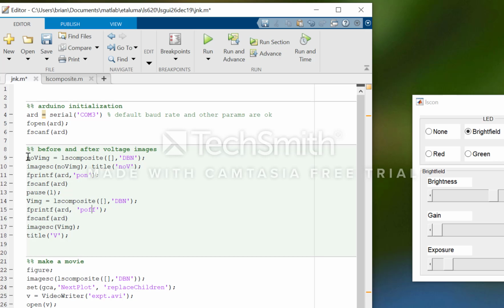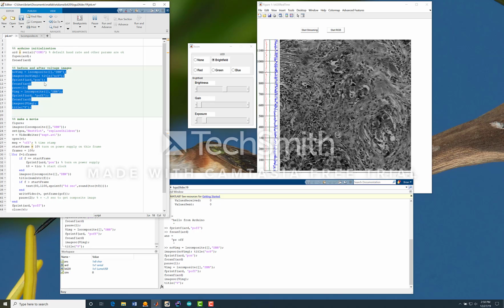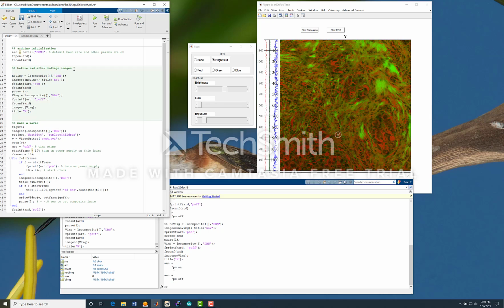So here is one example of scripting where we can take a picture, a composite image, using bright field for red, green fluorescence for the green, and nothing for the blue. So we'll make a composite image and take that before we turn on the voltage. And then we pause for a second. We take a composite image afterwards and we'll display that. So again, just executing this little script. There we have the two images, and the composite is shown. I didn't expect to plop it into the main figure here, but I guess I forgot to create a new figure for that, and this might be a little bit cleaner.